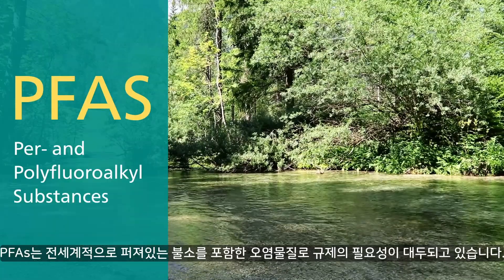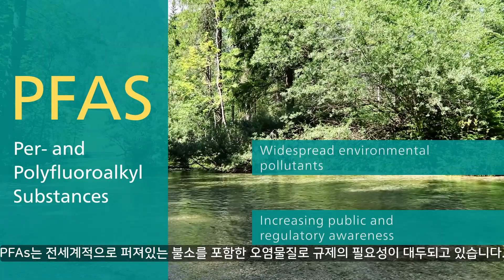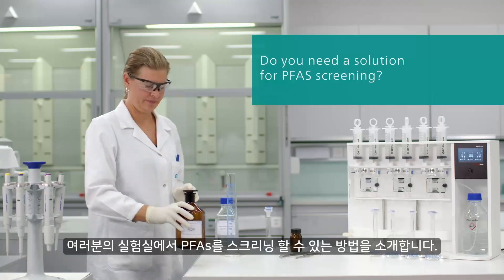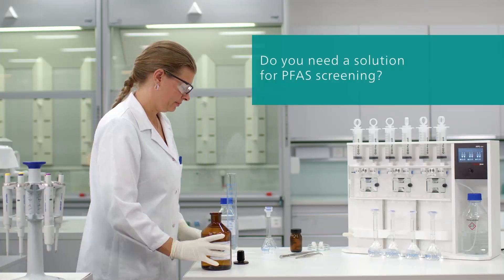PFAS are fluorine-containing pollutants that have become widespread in the environment. Does your lab need a solution for PFAS screening and measurements?